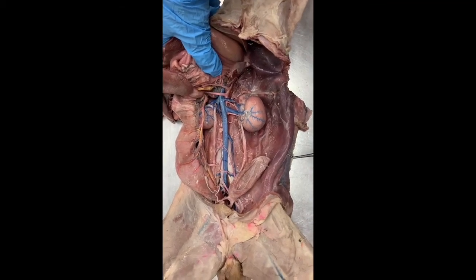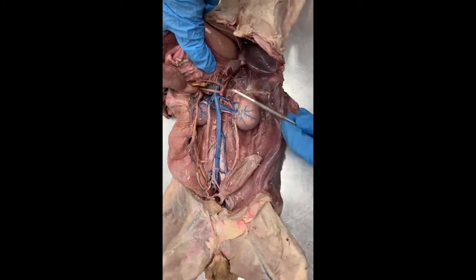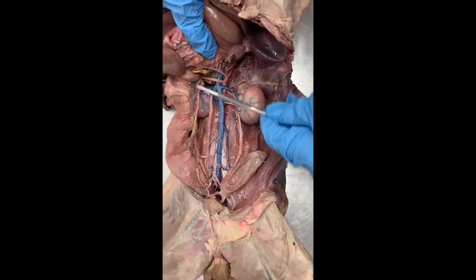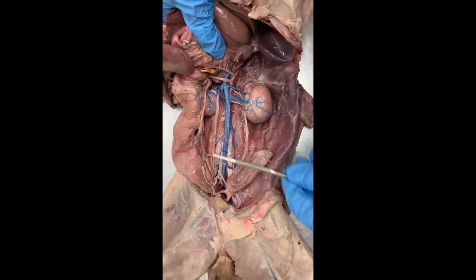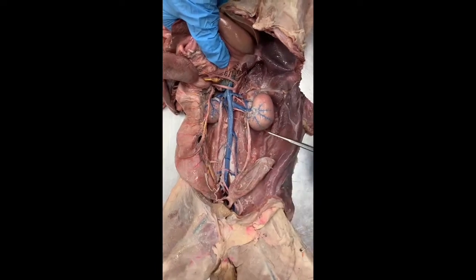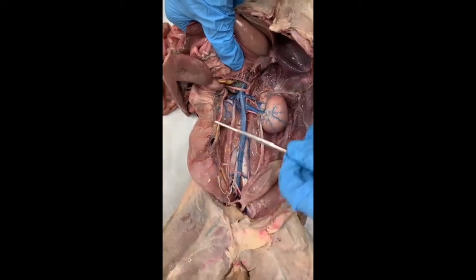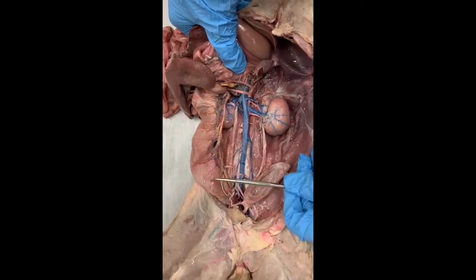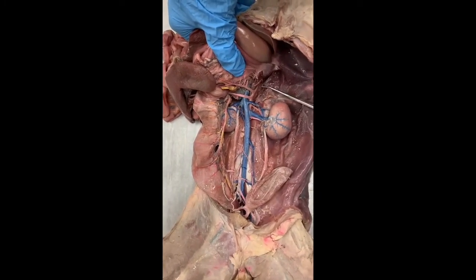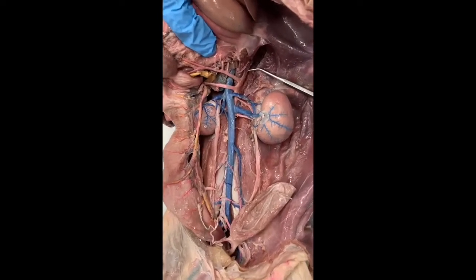This is a video of the gastrointestinal arteries and veins. Starting with a zoomed-out picture of the entire posterior abdominal wall, you can see the kidneys and the colon flipped over — this is actually the descending colon. You can also see the bladder caudally. I'm going to start cranially and show the abdominal aorta here.